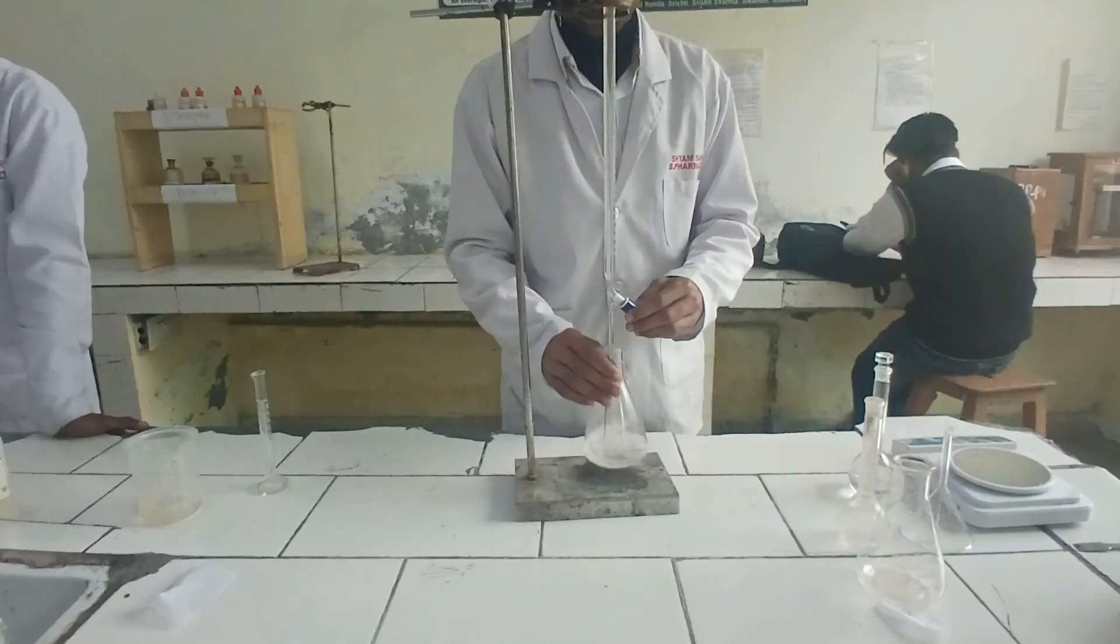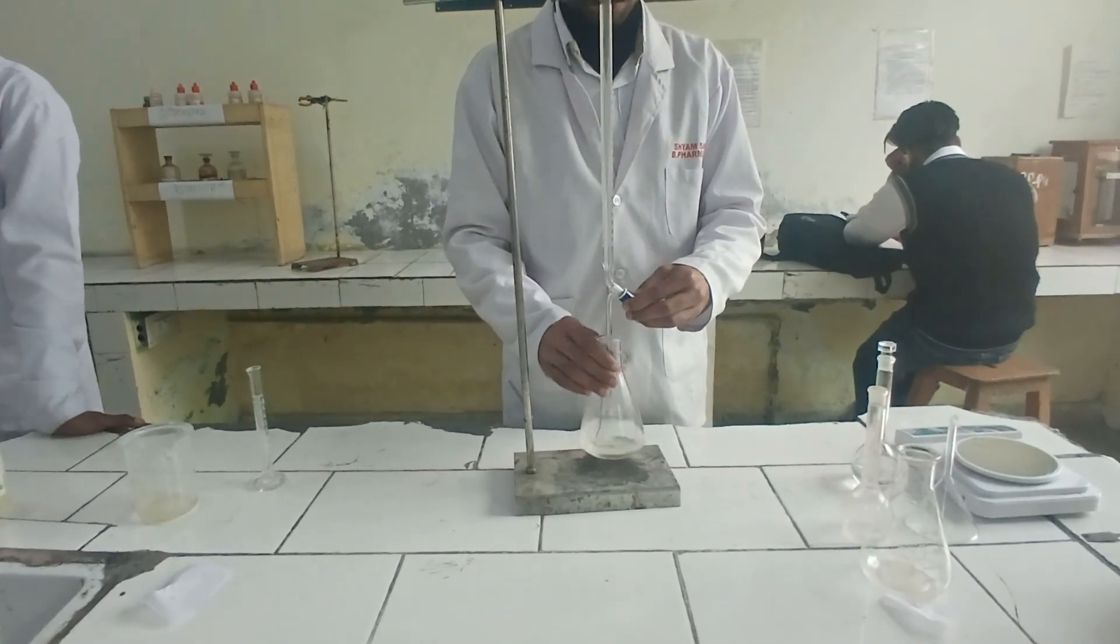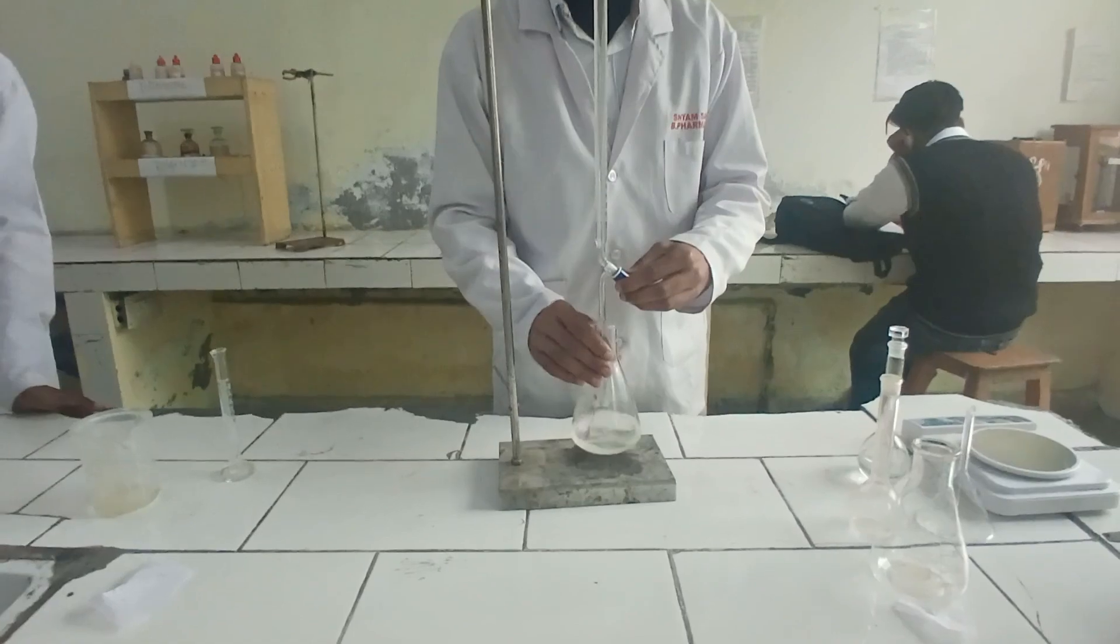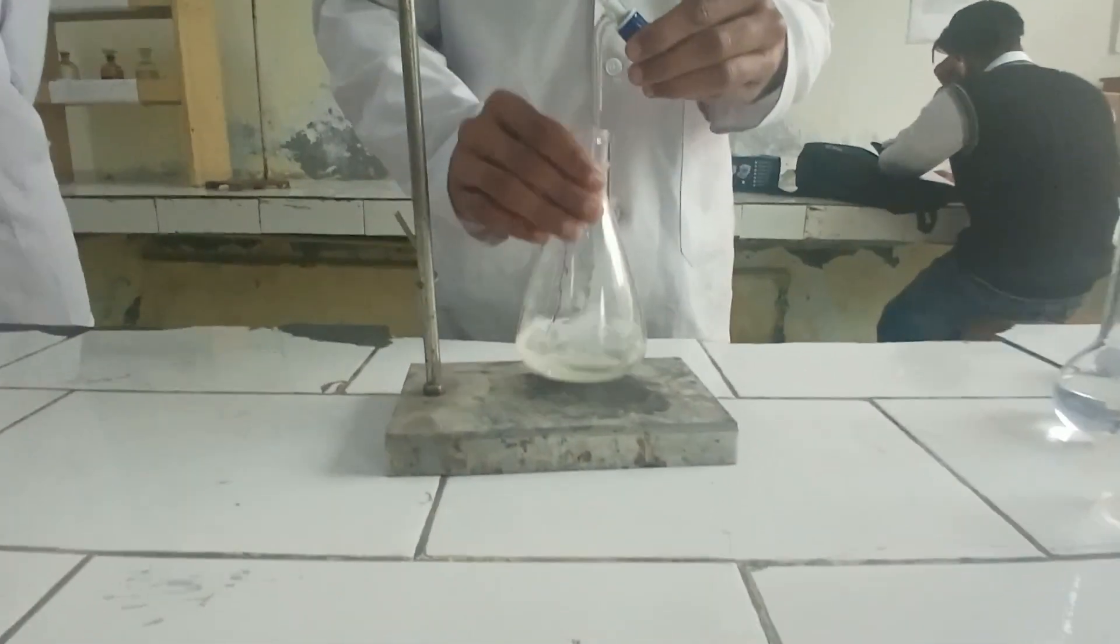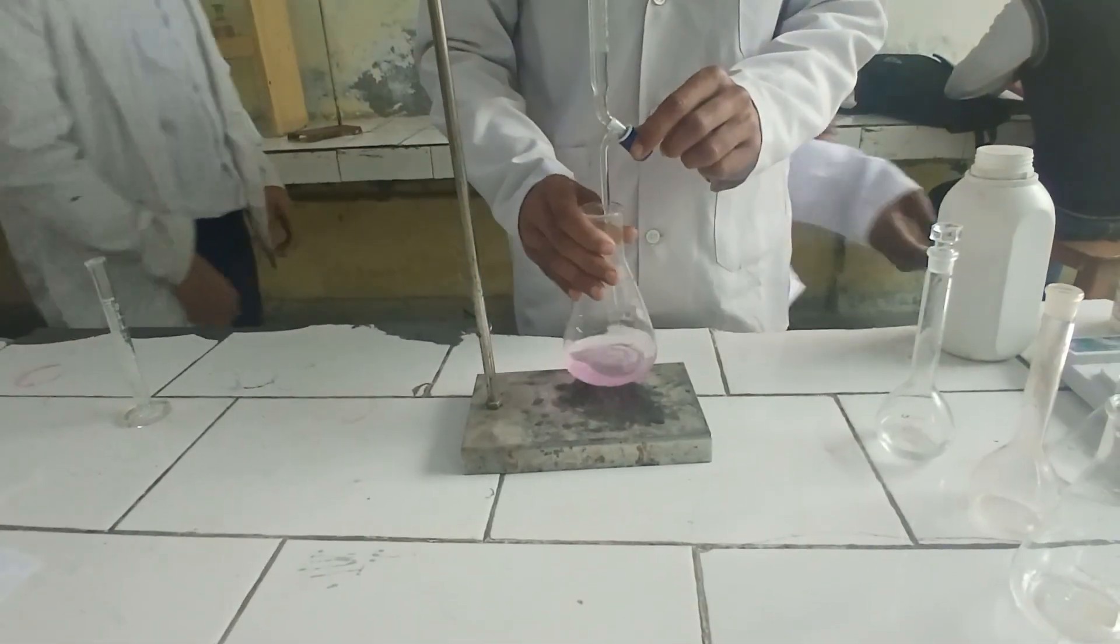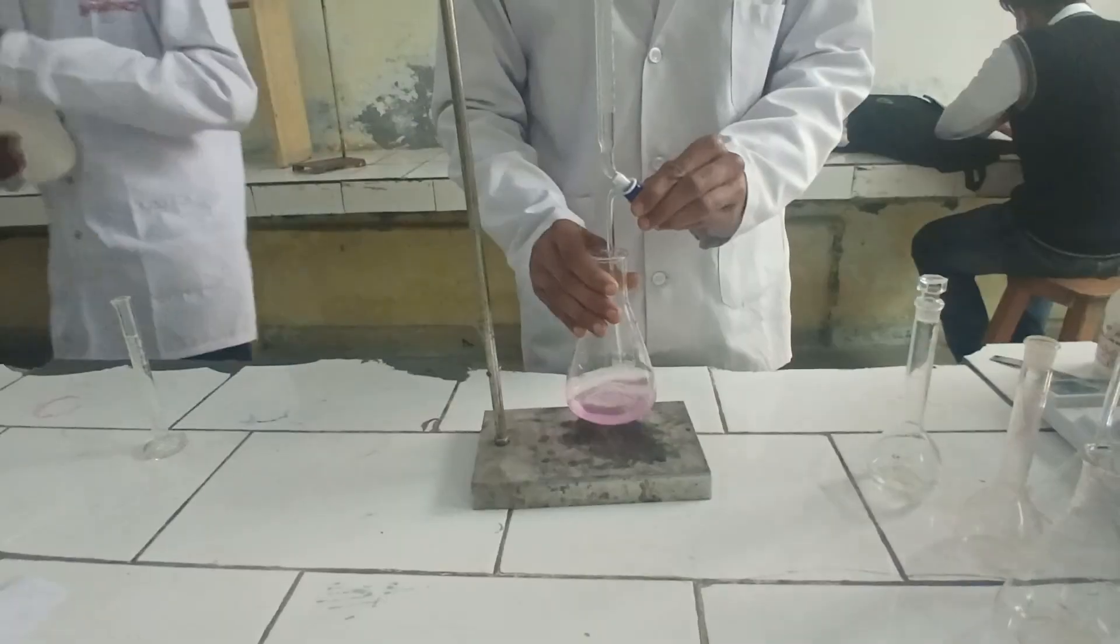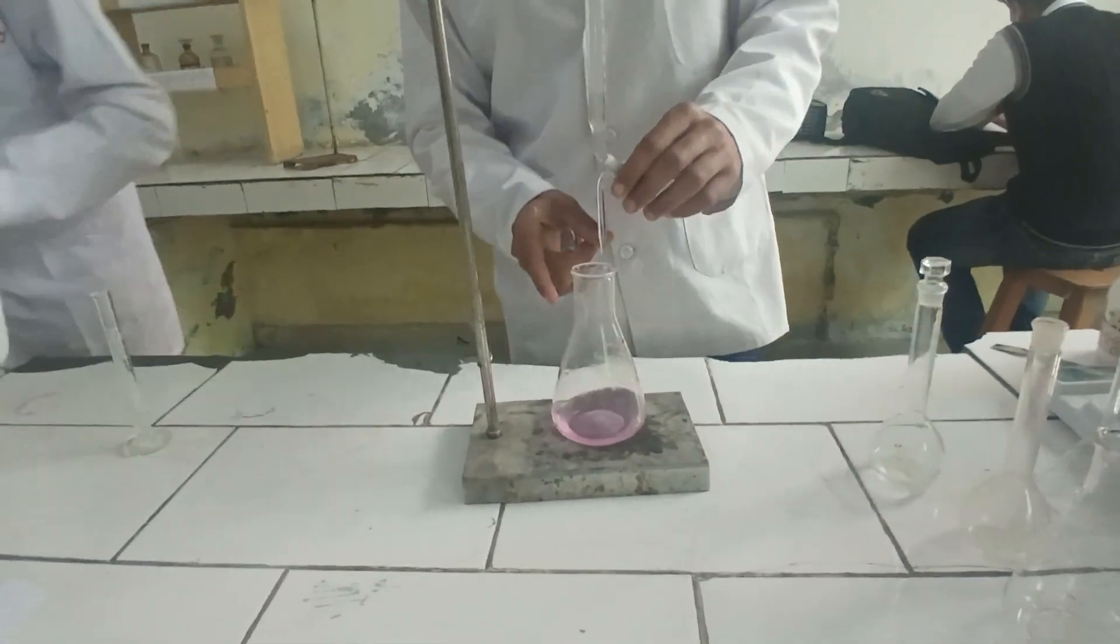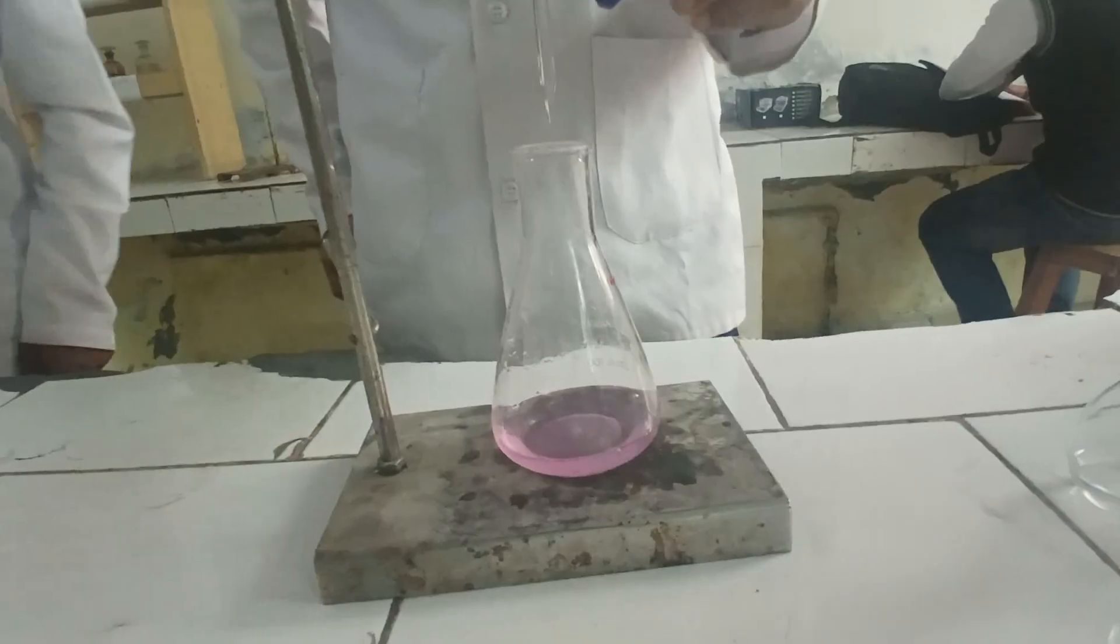We will repeat this titration for 3 times for accurate results. Here, you can see that the result that we need is here. That is the light pink color. Note down the reading after obtaining the color.